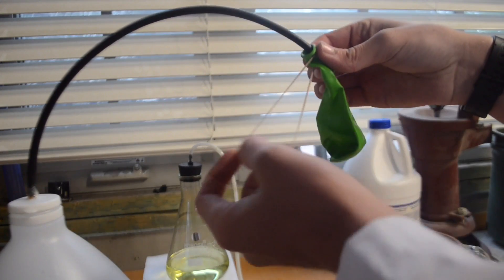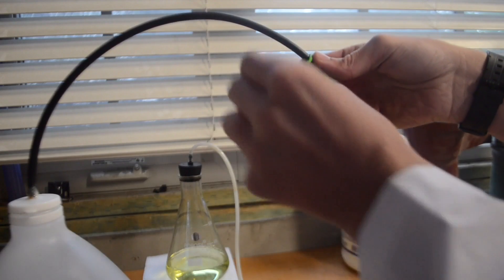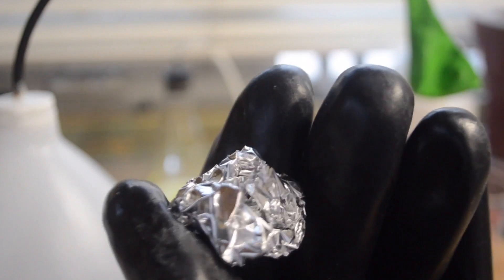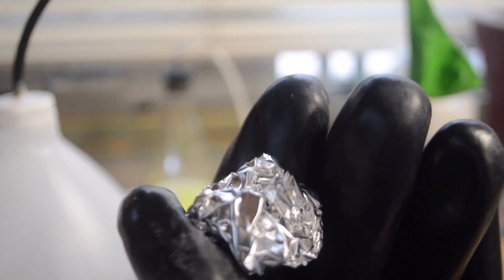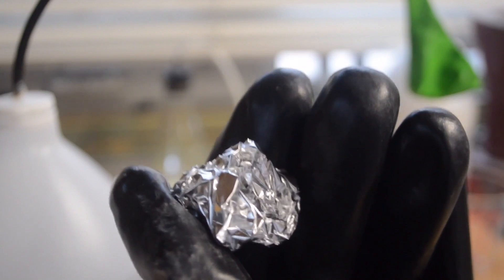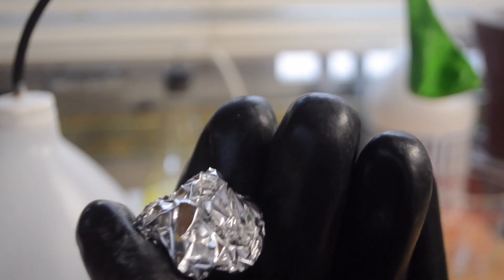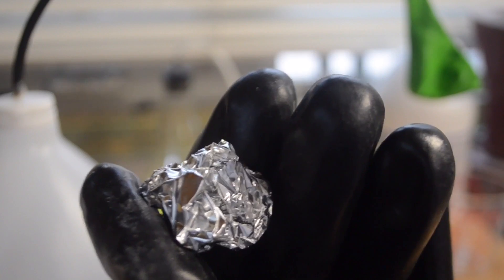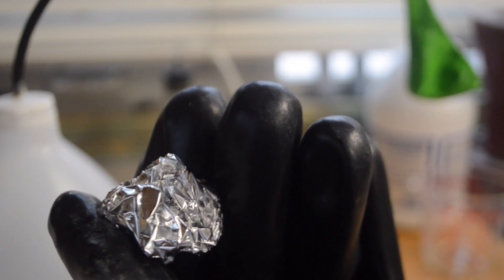Now I'm going to use this rubber band to attach the balloon to the output of the bubbler. As you can see, I took some of the aluminum foil and crunched it up into a ball. Although more surface area will make the reaction go faster, for my particular setup the tube is so small that if I make the reaction go too fast, the pressure will build and blow the top off of the flask. So I'm going to stick to this one big piece here to see what happens. Now I'm going to add the foil to the flask, and then in a second it should start reacting.